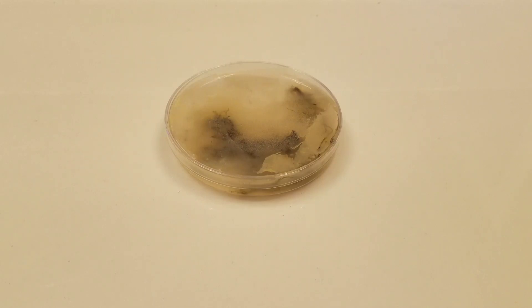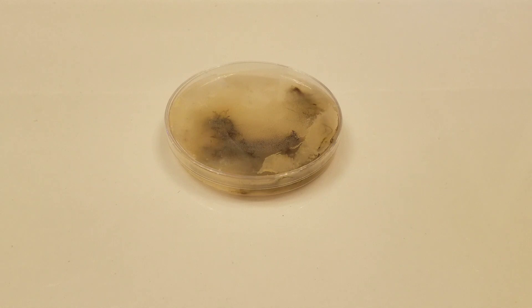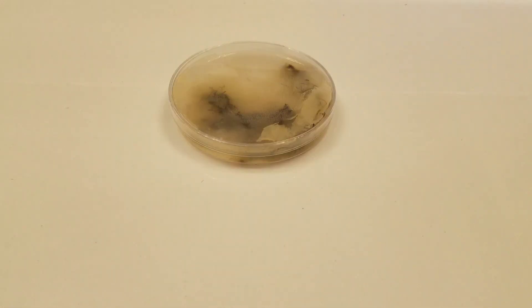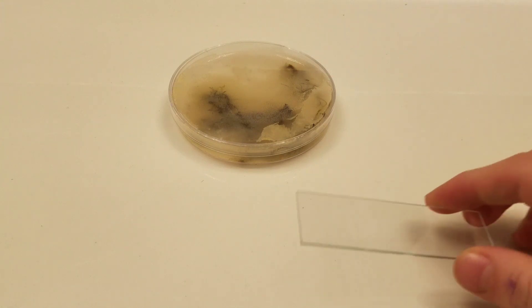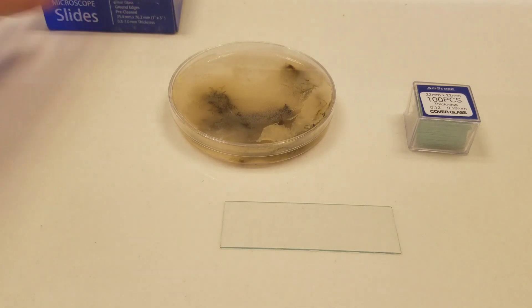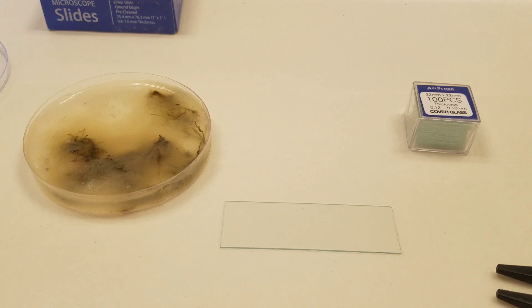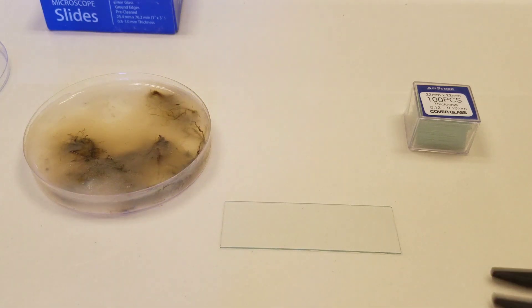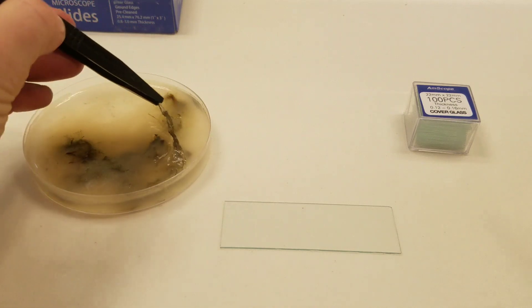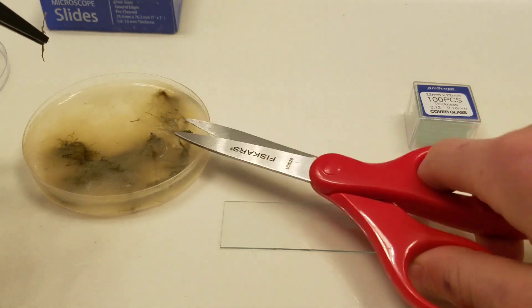What is up guys, the 46 Chromosome here. Today we're going to be seeing if milk increases the population of microorganisms inside a controlled environment. This environment is a petri dish — I had a sample from a river with some algae and stuff, and I put milk in it for a week or two. I think I put a little bit too much, but let's see what happens. I'm going to take a little bit and put it on the slide. I've already looked at the results and it's surprising.